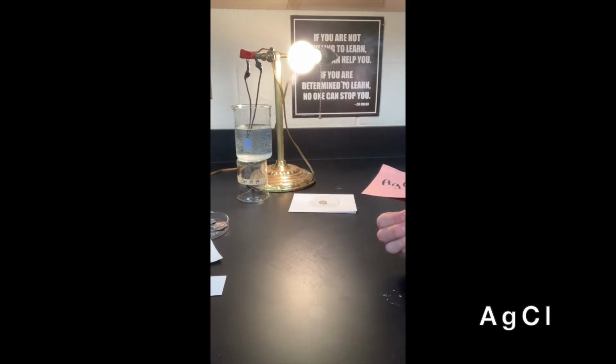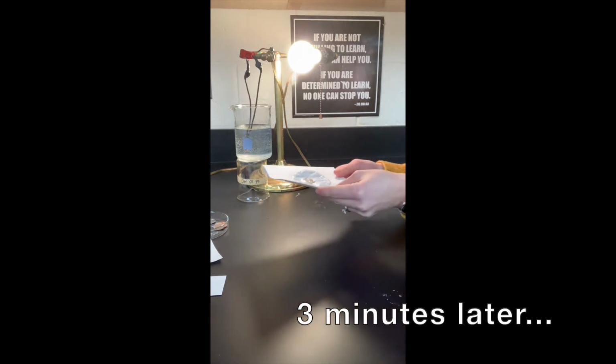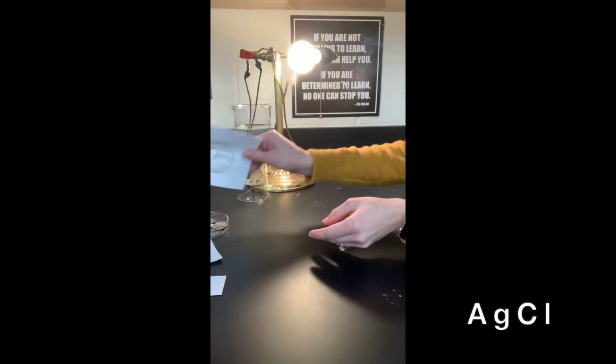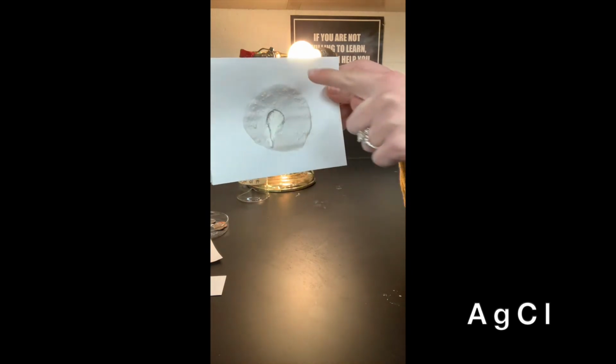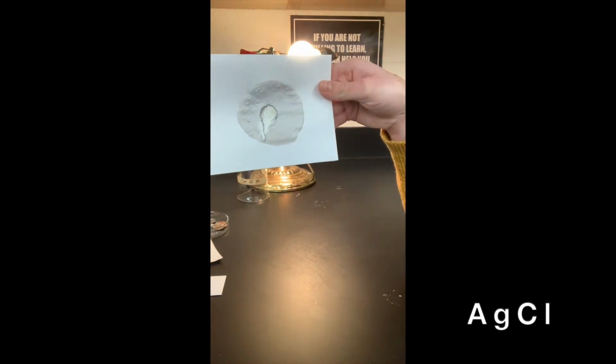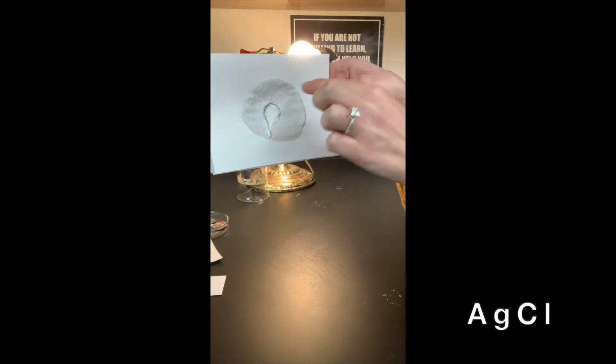So we're gonna let this sit for a little bit and come back and look at it after about 3 minutes, all right? So let's take a look at this. So I'm gonna dump off the coin. So you can kind of see where the coin was, how it's still really white, and now we kind of have this gray around. If you let it sit for longer, we'd see even a darker gray color form, but just after 3 minutes, we can already see how that reaction happened because we can see the color change.